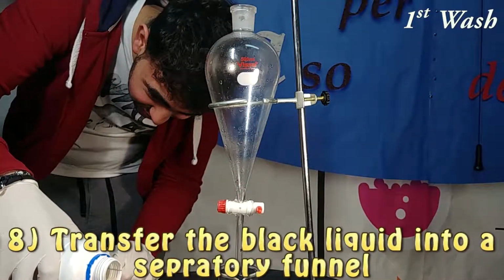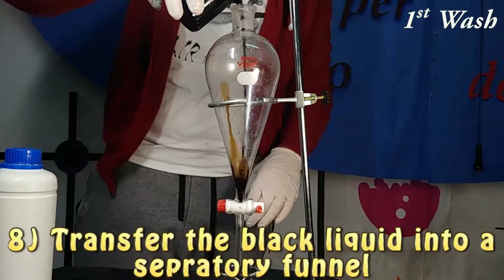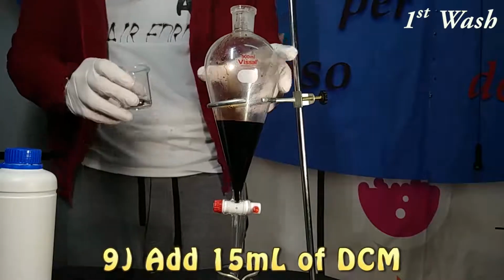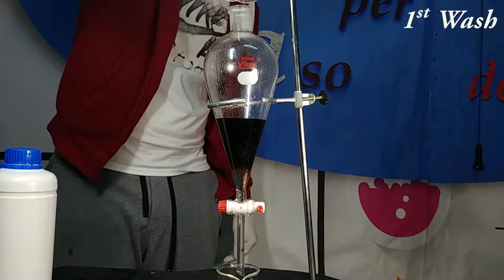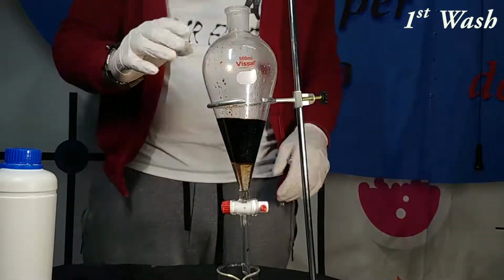So now we're going to start our extraction part. For it we're going to need some dichloromethane or DCM, and what we're going to do first is to transfer all our black liquid into a separatory funnel. Then we are going to wash the recipient in which this liquid was contained, a beaker, with 15 milliliters of dichloromethane, and pour it into our separatory funnel.